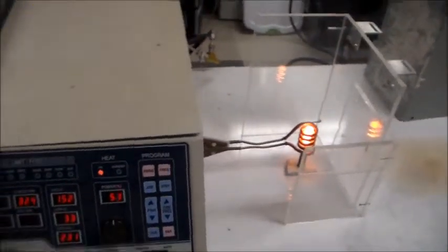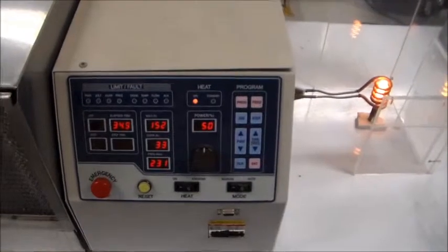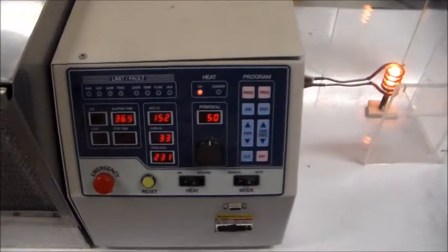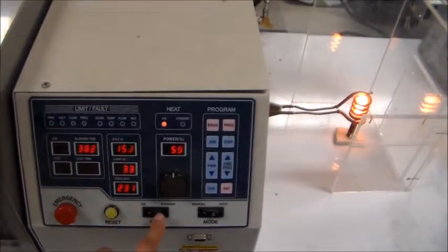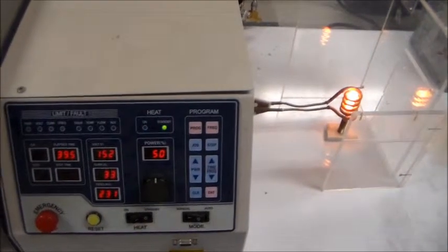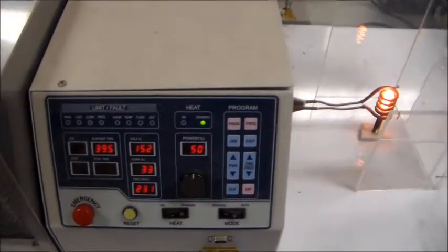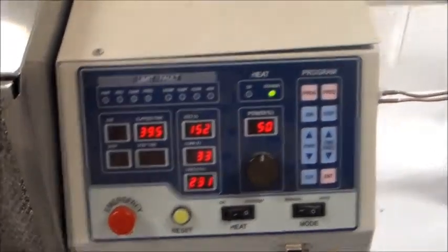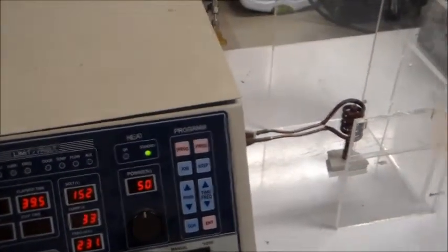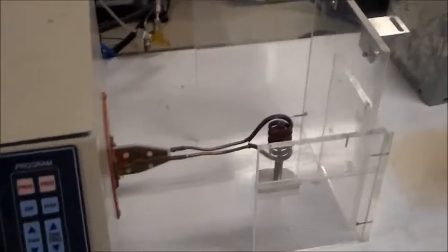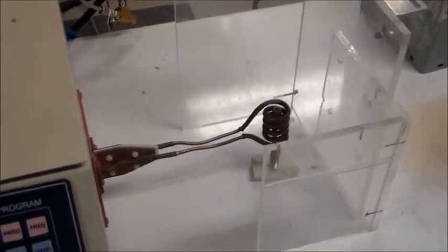Once you are done with your test, the first step is to switch again the heat switch into the standby position. Make sure you wait until your material sample is cooled before removing it from the heating coil.